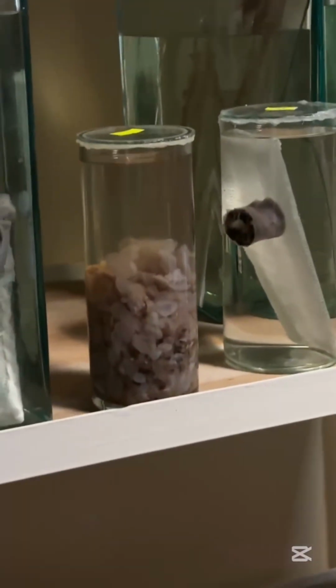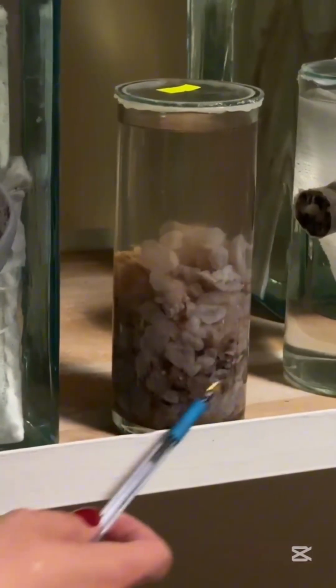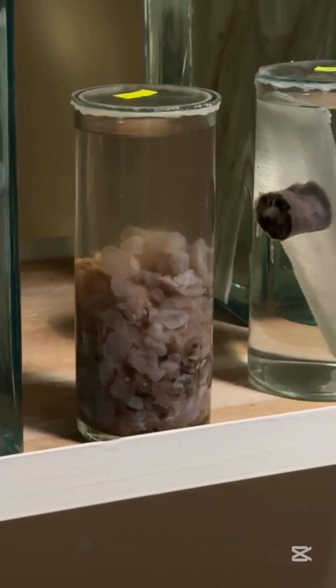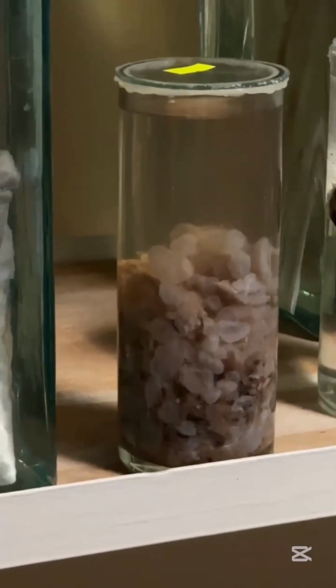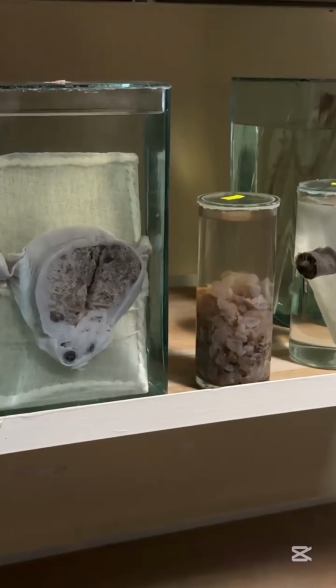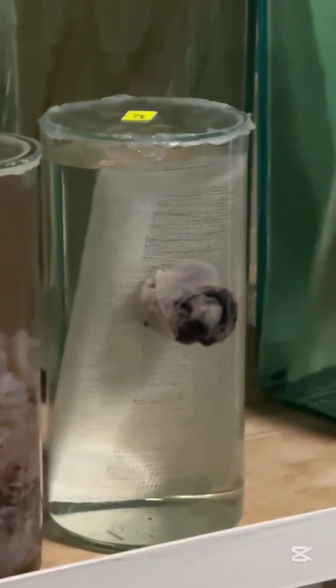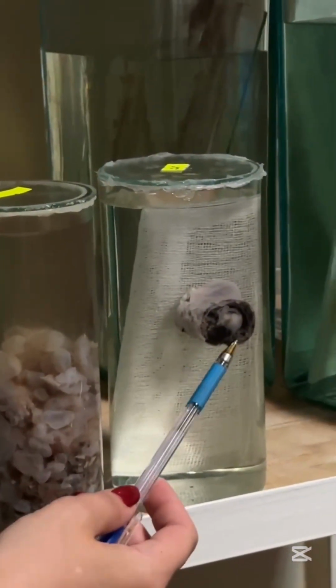This one, hydatidiform mole, a benign tumor of chorionic villi. You can see multiple swollen, edematous, avascular chorionic villi. The tumor is benign, and again, like the previous one, can produce HCG. This one, previous class again, ectopic tubal pregnancy, fallopian tube, fetus inside, hemorrhages in the wall, and the most common complication is rupture of the fallopian tube and internal bleeding.